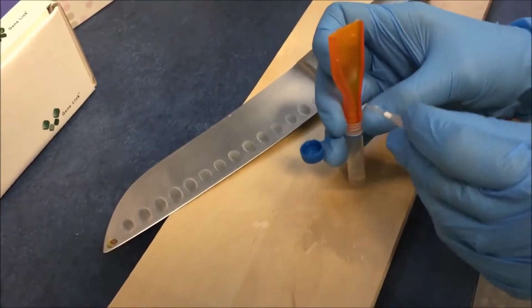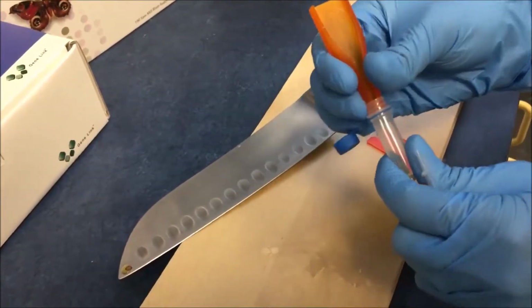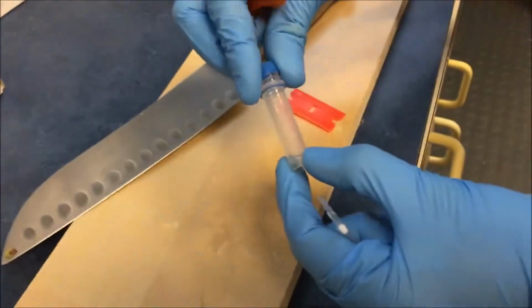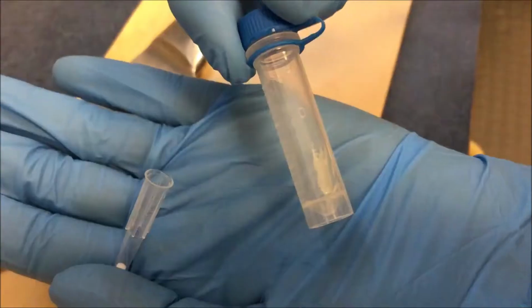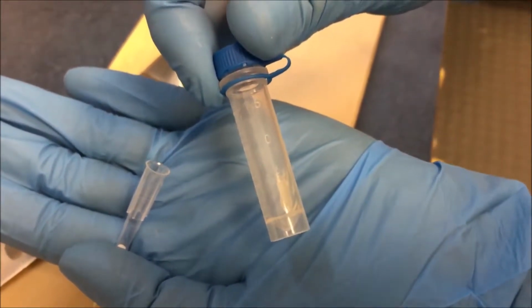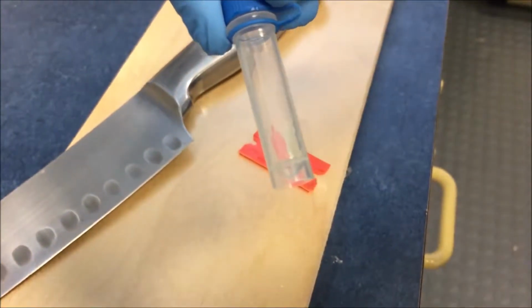After it is collected, as we know that it is all dried, and this is just a beta version, there will be more improvement to this. So we take away the scraper side, and then the sample is collected at the bottom of the tube. The sample is collected at the bottom of the tube, and this tube, after appropriate labeling, is then sent to the lab for DNA extraction and processing.